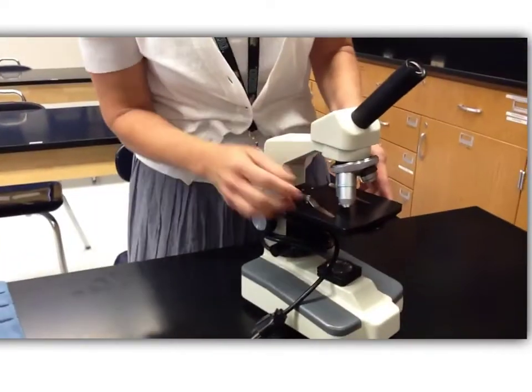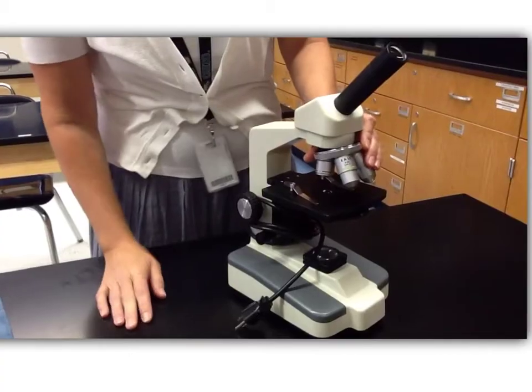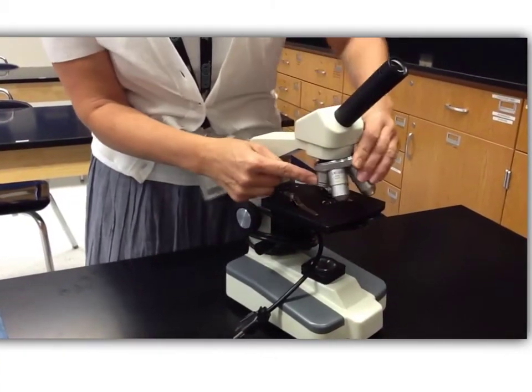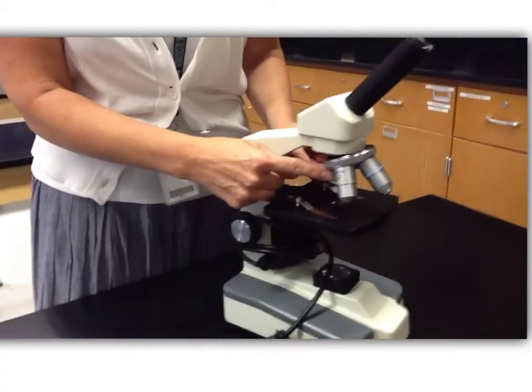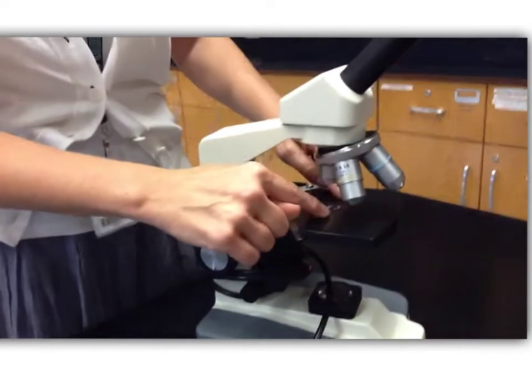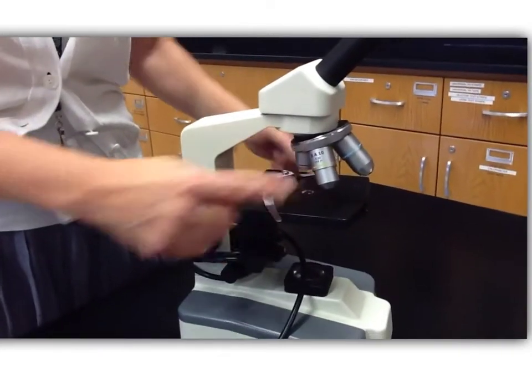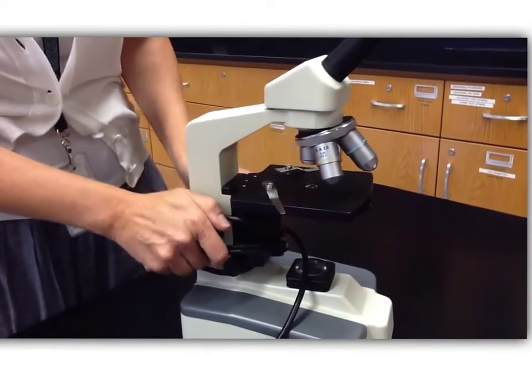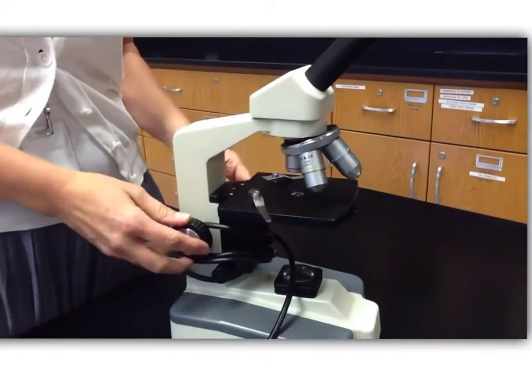What you would do with the microscope to magnify for the first time, you're going to make sure that the lowest lens is down. You're going to place your slide on the stage, and you're going to make sure that your stage is all the way up to the top.